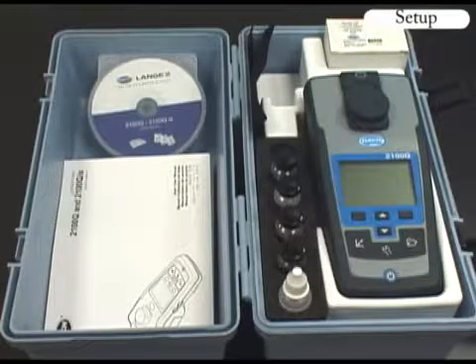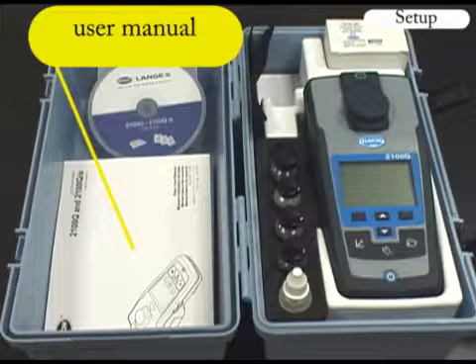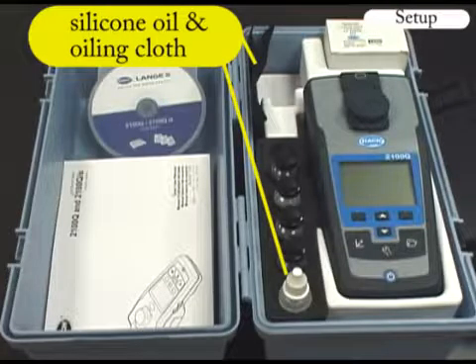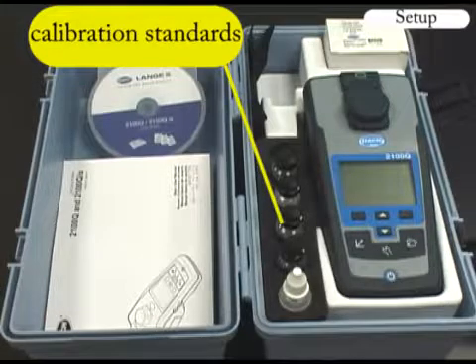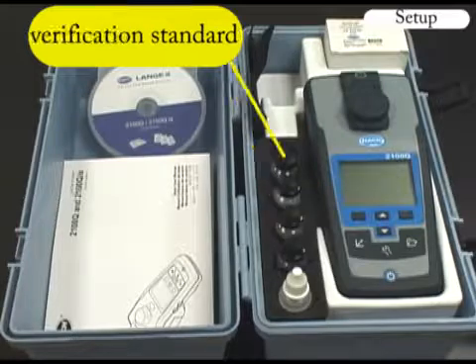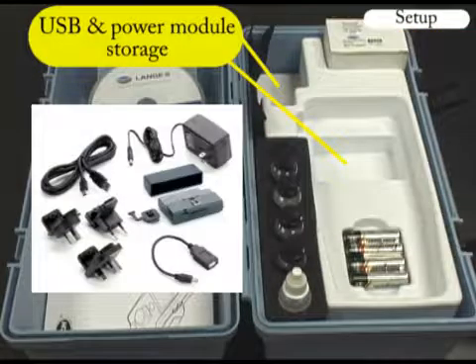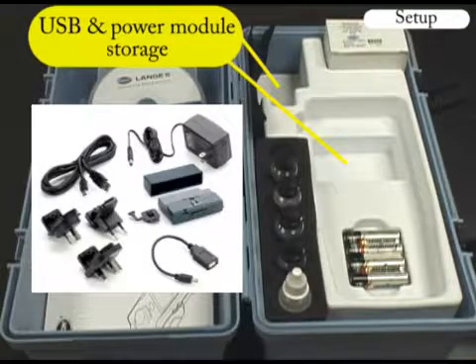This is a view of the 2100Q and its components, including the carrying case, the meter, printed basic user manual, full user manual on CD-ROM, silicone oil and oiling cloth, a package of six sample cells with caps, three StableCal calibration standards at 20, 100, and 800 NTU, a 10 NTU StableCal verification standard, and four AA alkaline batteries. There are also open positions inside the case to store the optional USB plus power module and its accessories.